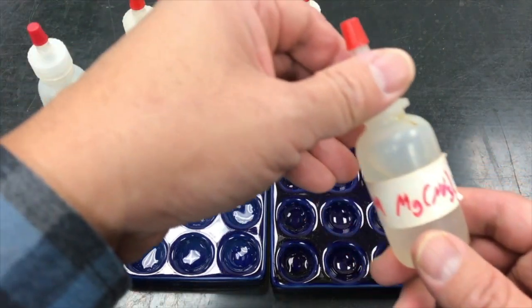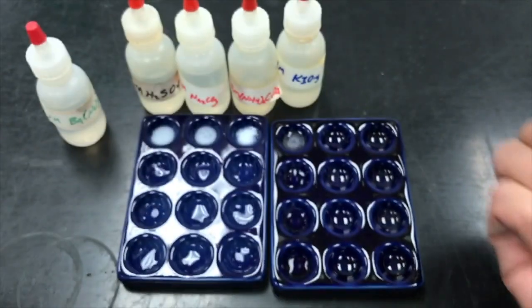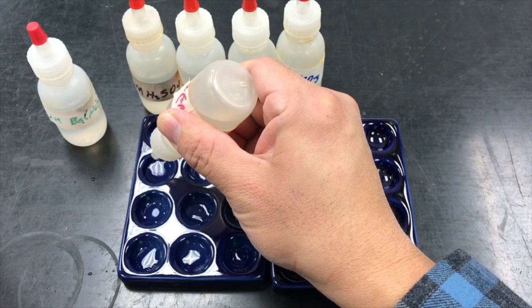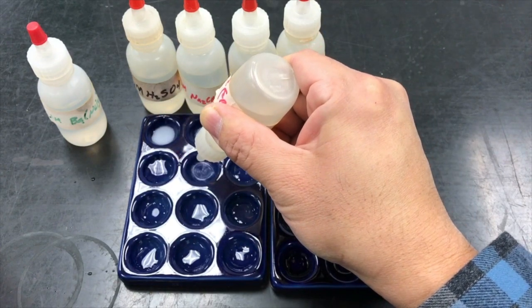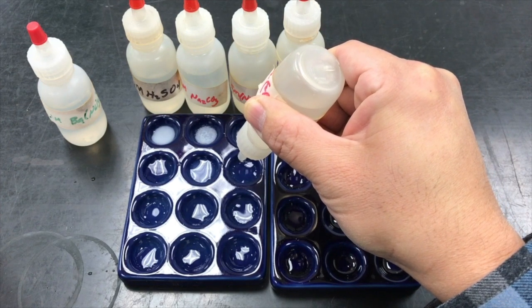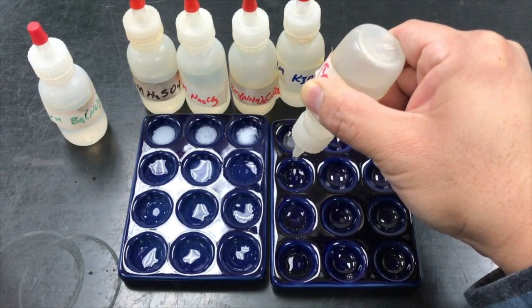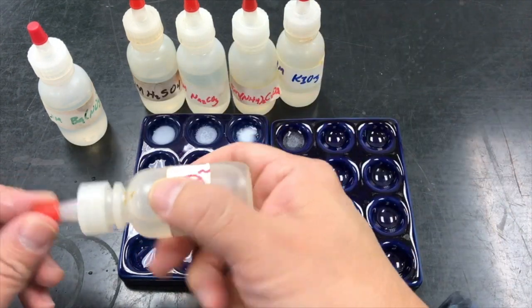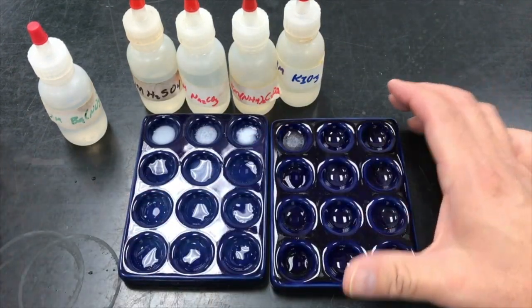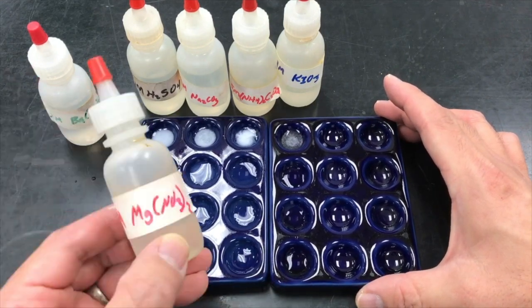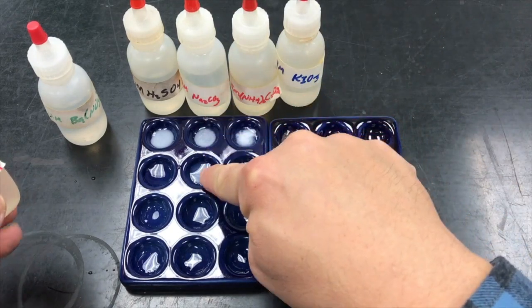Now we're going to react the magnesium nitrate. And it seems that we only really get precipitation between the magnesium nitrates and the sodium carbonates.